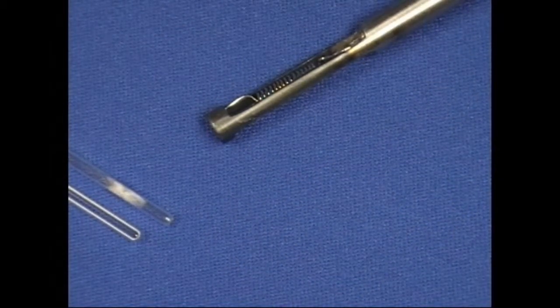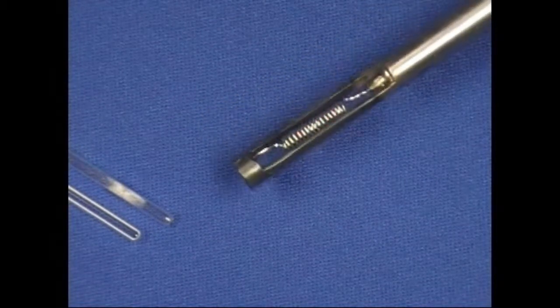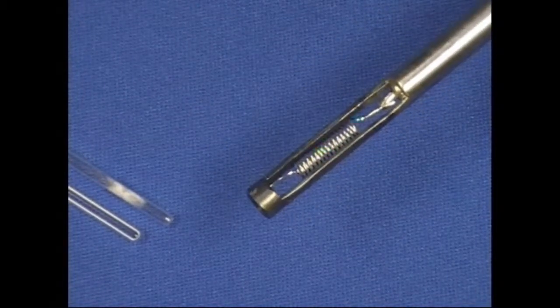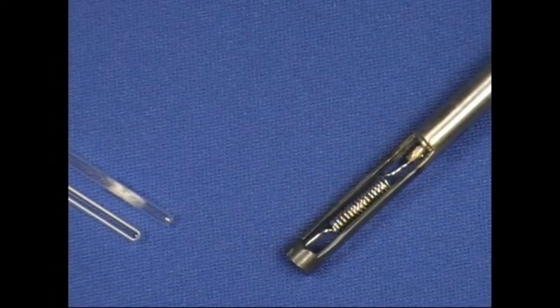And the coil probe is a spiral of platinum, and the sample is put into a quartz tube or a quartz boat.